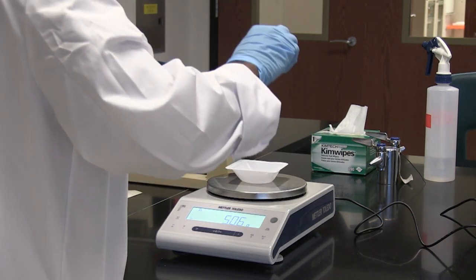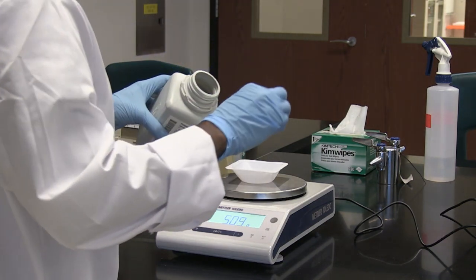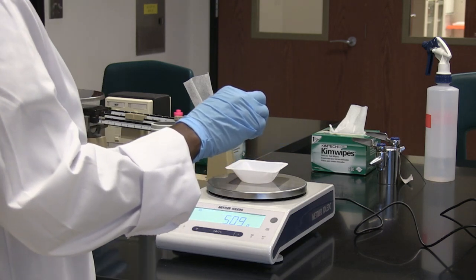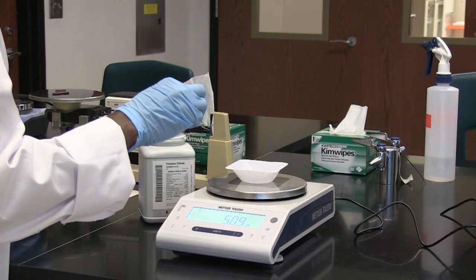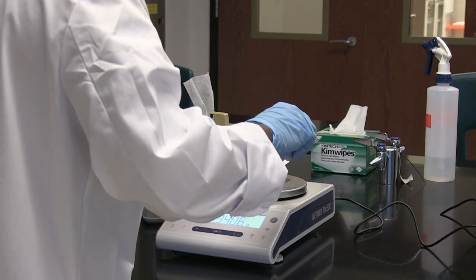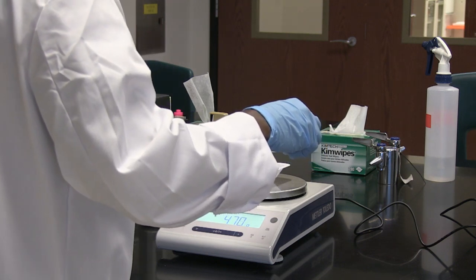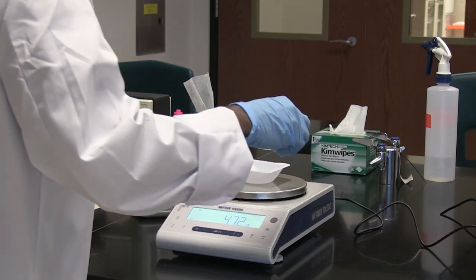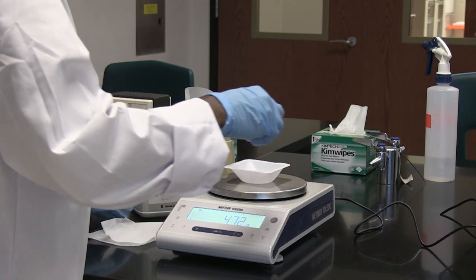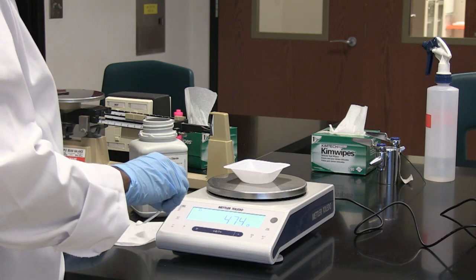I try to add the salt carefully so that I do not spill the salt over onto the weigh boat. So if you notice, I'm way past the 3.22 mark, so I have to take out some of my salt. Because I don't want to put it back into my container, I will put the excess salt onto a kim wipe. It's telling me it's 4.74 grams.